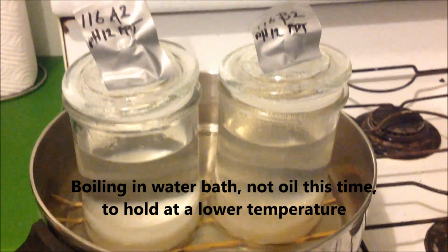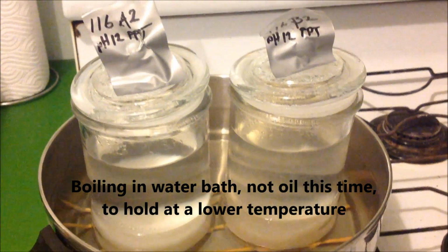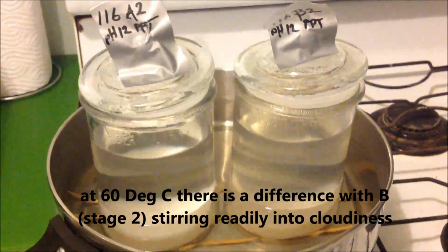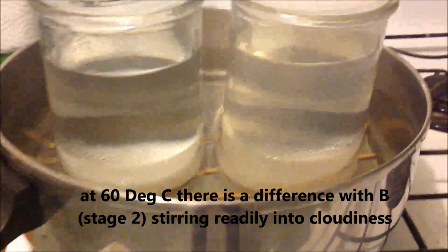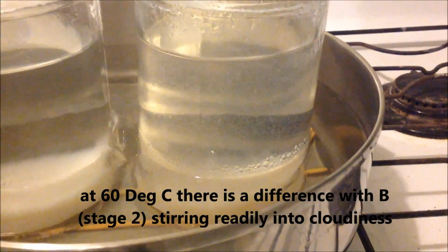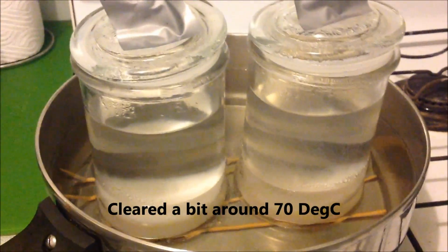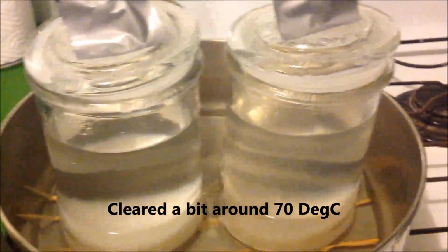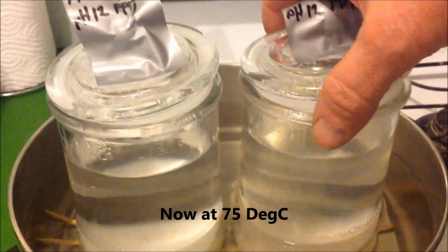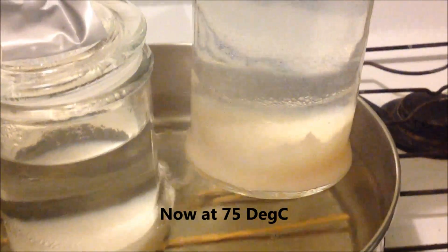Heating up by 60 degrees, B had gone cloudy, but by 70 degrees it had roughly cleared up. You can probably see it stirring there, whereas A has remained clear all the way through. We're at about 75 degrees now on both of them. Let's see if I can lift this up and keep it in the frame.